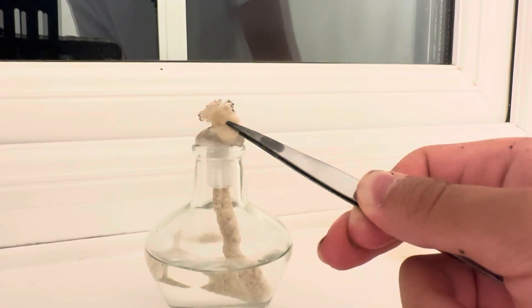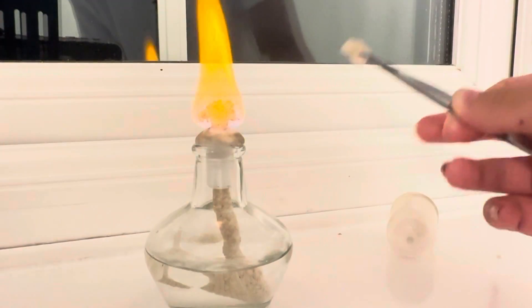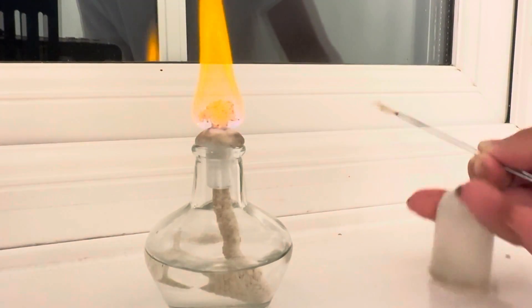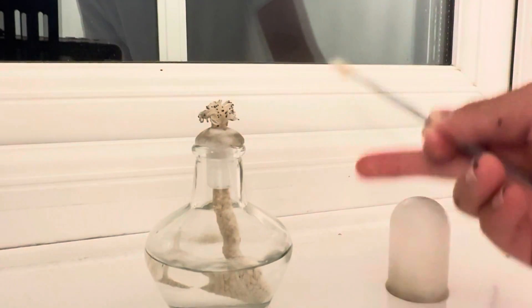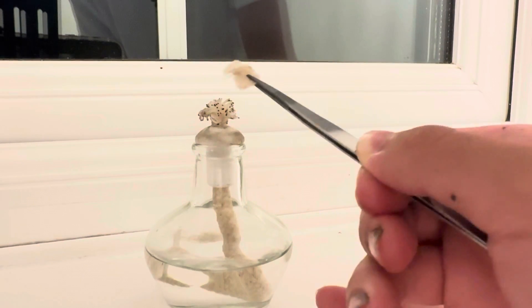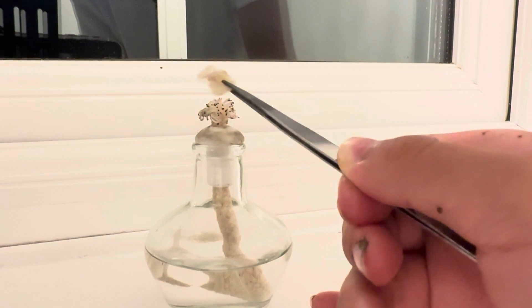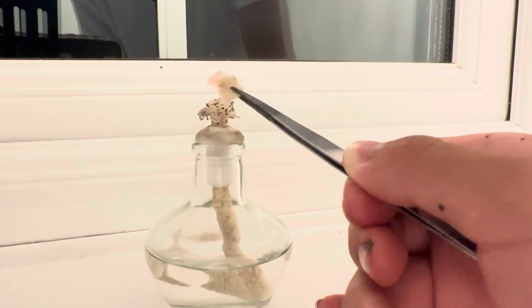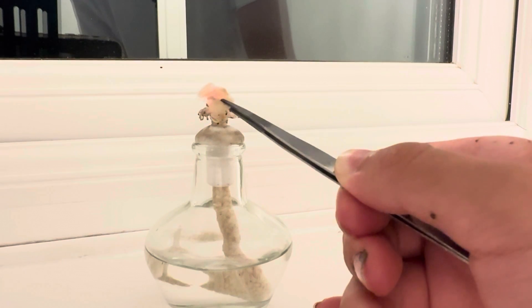If we place it at some distance, we can let the wool keep on glowing without igniting the alcohol, which requires some challenge to do so. Just put it here. You can see the wool is always glowing just slightly but it never ignites.